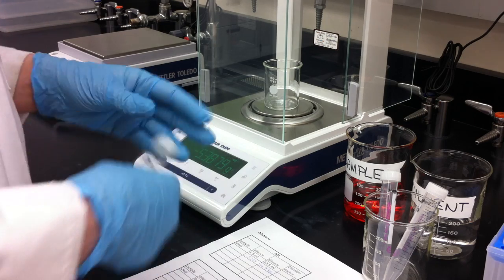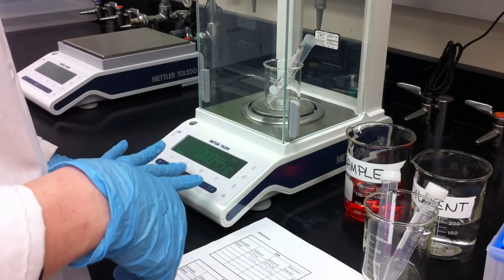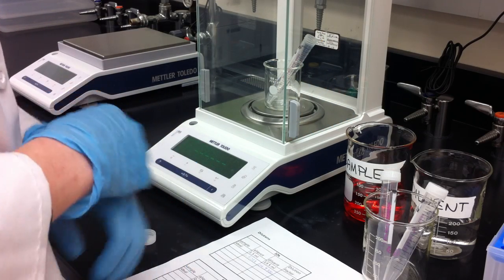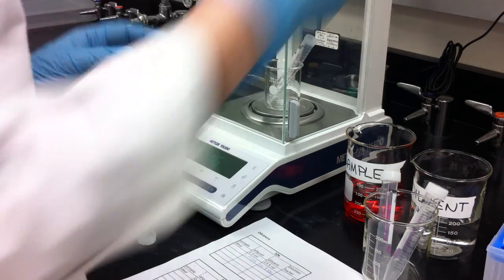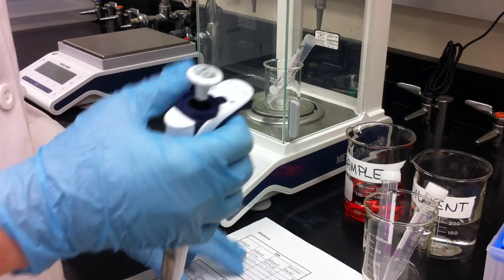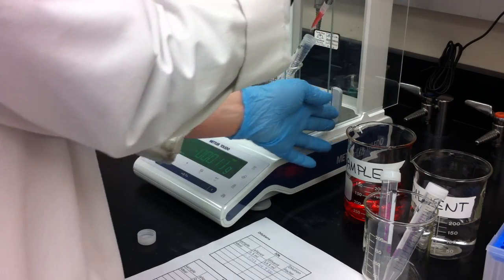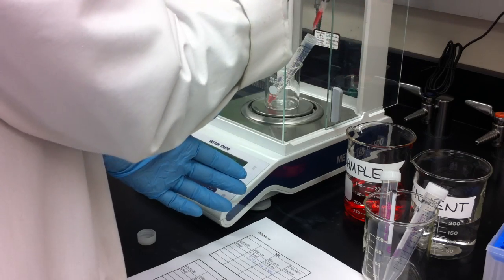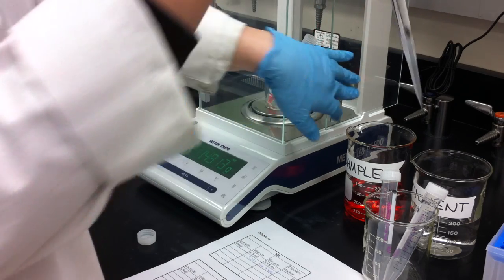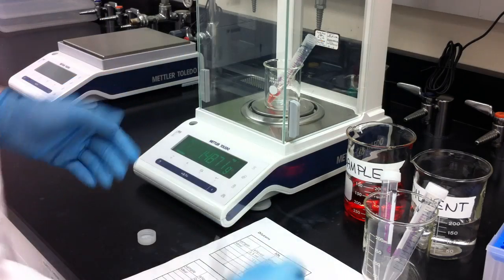So basically what we're going to do is we're going to make a 10x first. So we'll stick our tube in there, tare it, so that way we have a 0 to start with. And so the first thing that we're going to do is add, for a 10x, if we want 15 mils total, we're going to add 1.5 milliliters of sample. So I'm going to do that by adding using a 1 mil pipette to add 2 aliquots of 0.75 mils. And then I'm just going to record that weight.